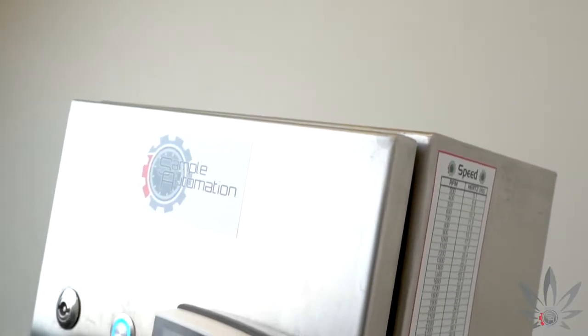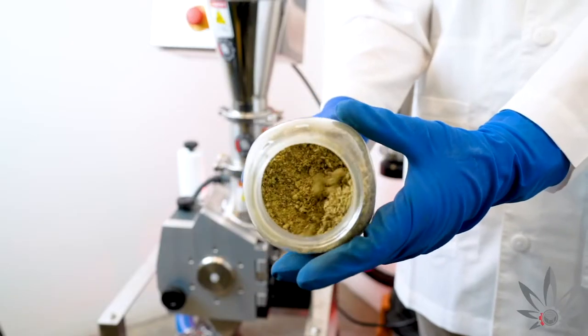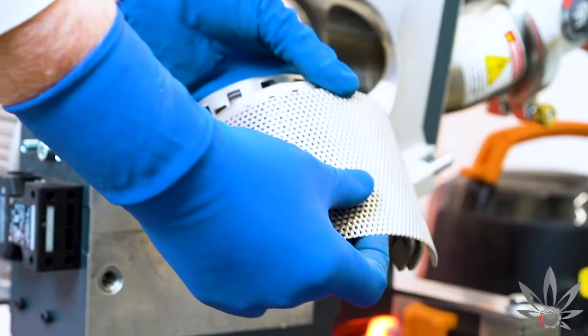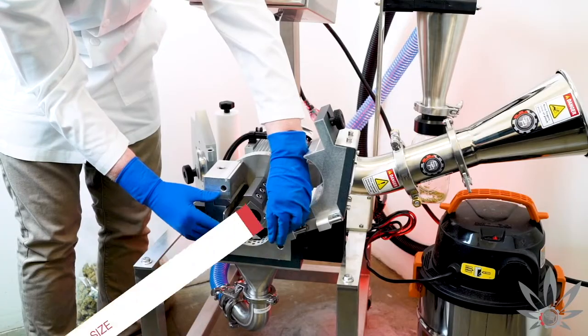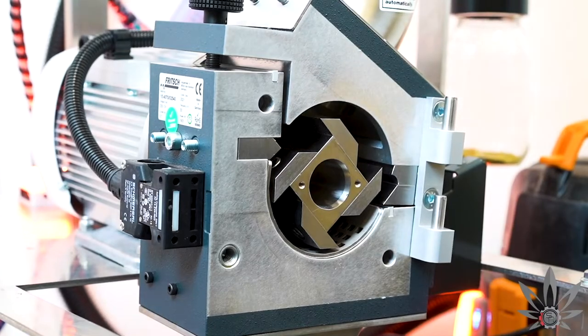Using the helpful guide on the control panel, you can adjust the RPM of the motor to match the quantity of material desired. By utilizing different sieve cassettes and feed rate, you can determine the exact particle size you want your product to be depending on the type of end product desired.